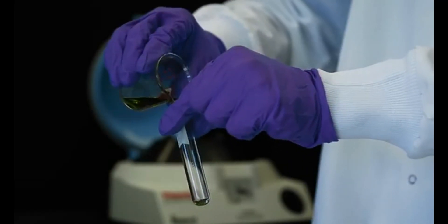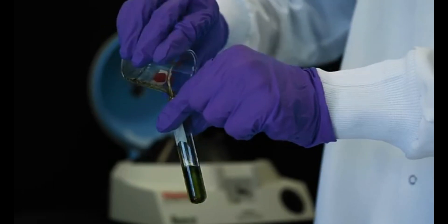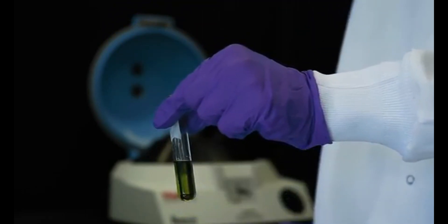Pour the liquid you wish to separate into a test tube. Do not pour all the way to the top. Leave the test tube half empty.